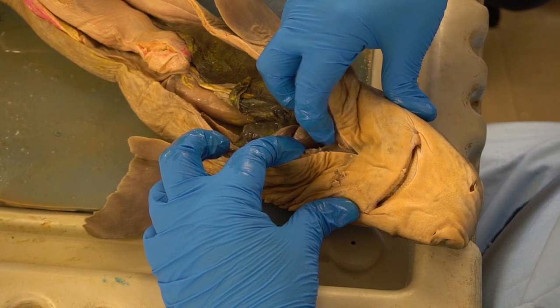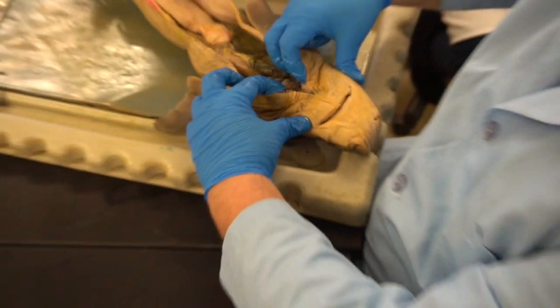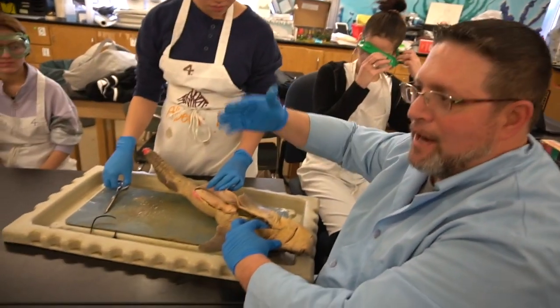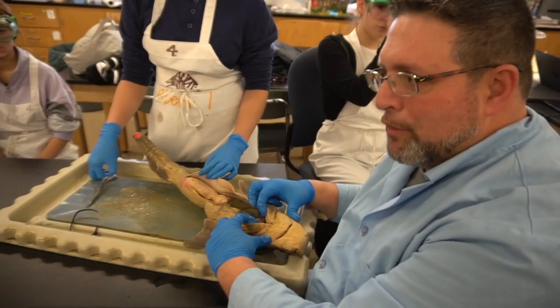These are dividing lines. Remember we talked about segmentation a lot through all the early dissections. This is evidence of segmentation. Remember back to the earthworm. When you cut it open, you saw each segment. They had a dividing part of each segment called a septum. This is a septum. That's a divider between cavities.